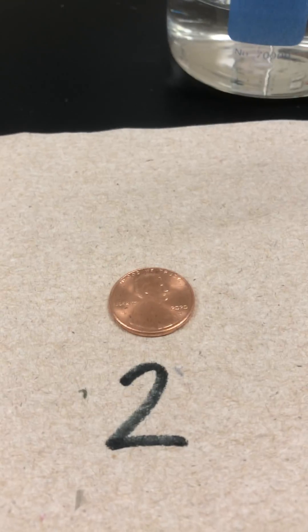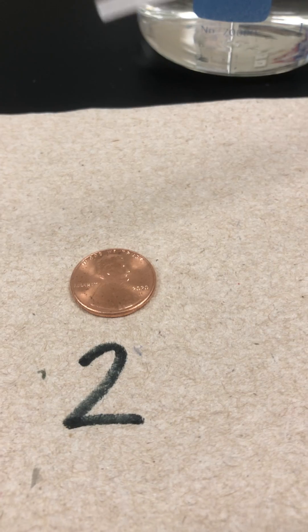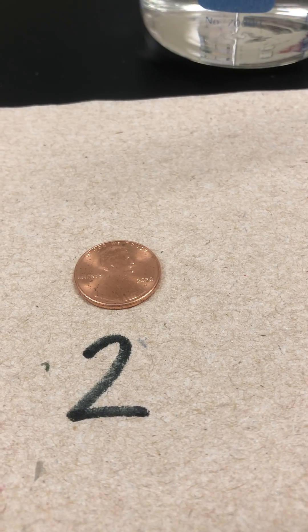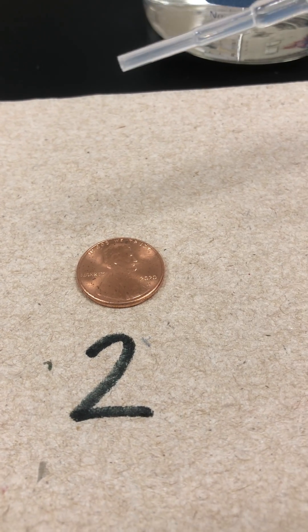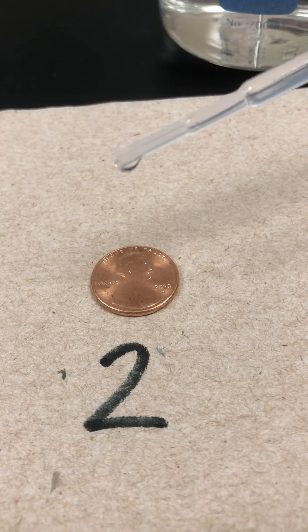Let's do trial number two. Please again count along with me — actually, you count. How many drops of acetone can go on our second penny? Trial number two.